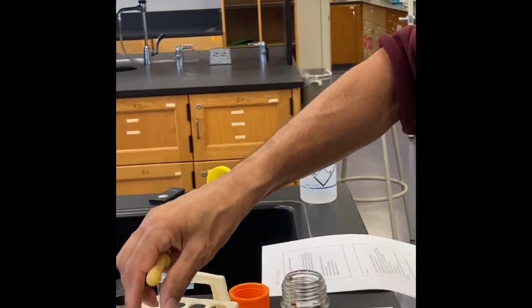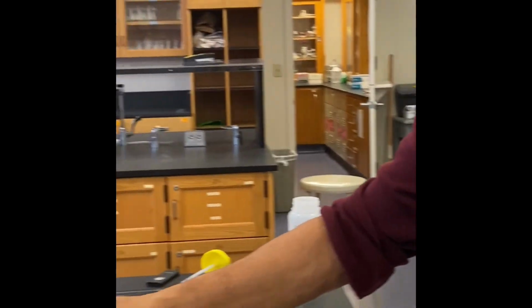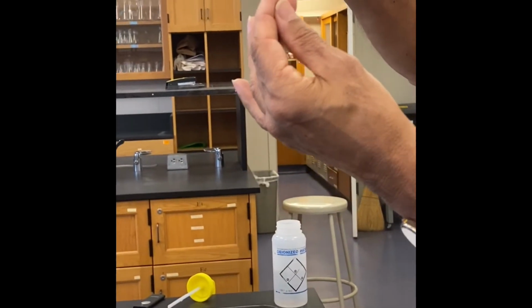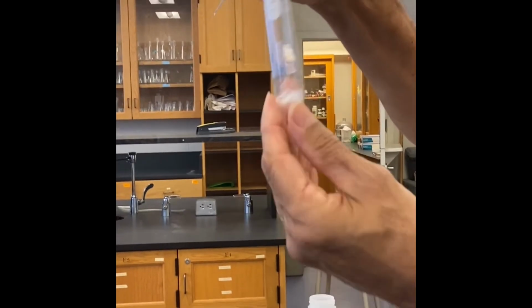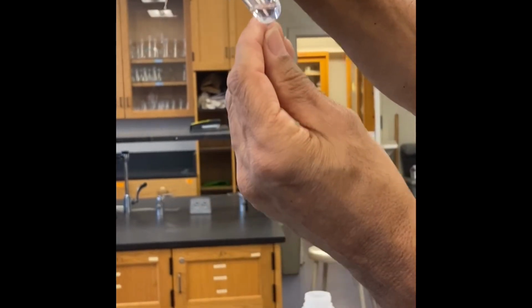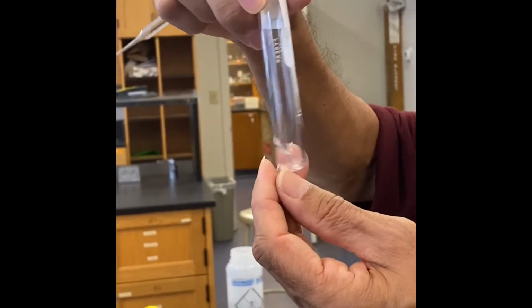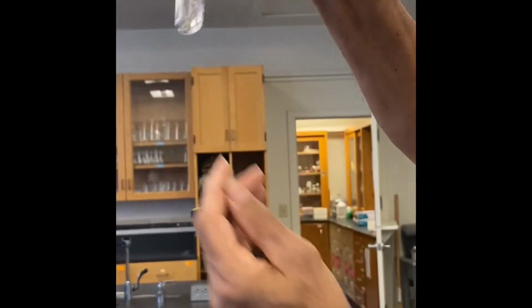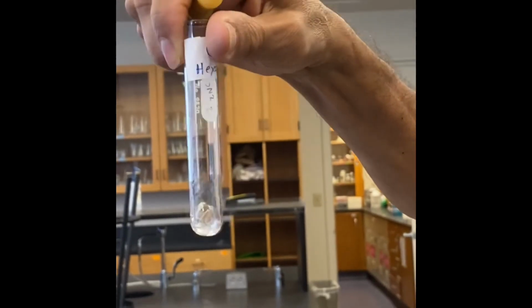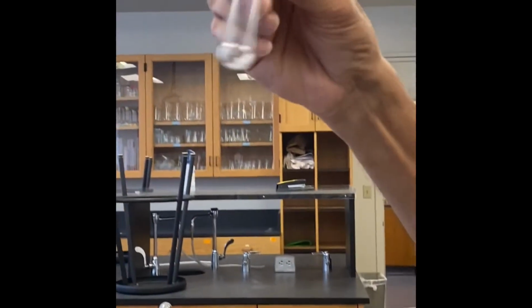The third one is hexane, right? It's a non-polar solvent. Biphenyl is non-polar, so we expect it to dissolve. I'm not sure. Let us see. I'm adding 1 ml. You just tap it to help it dissolve because they are crystals. It takes a while. When the compound is crystalline, it takes a while to dissolve because they have to break the crystal lattice. See? You can see now pretty much everything is dissolved. And the fourth one is what? The reference compound, this much, right?